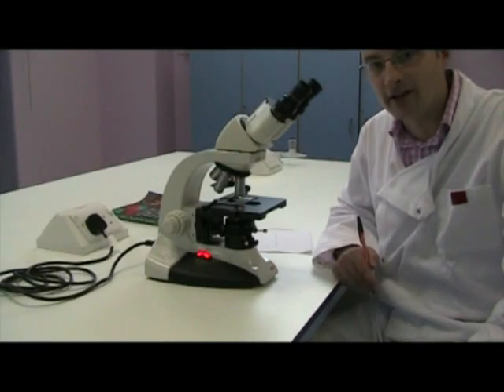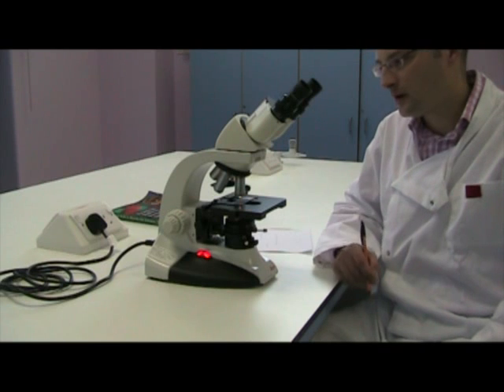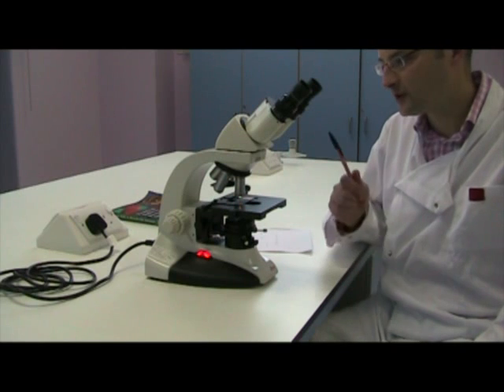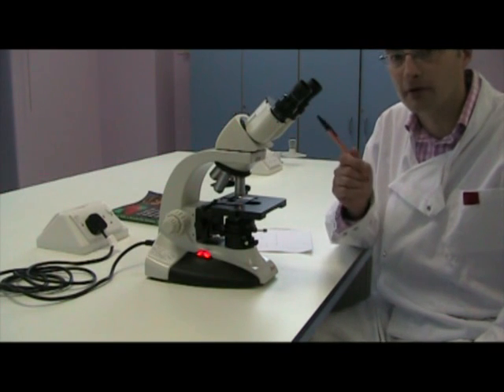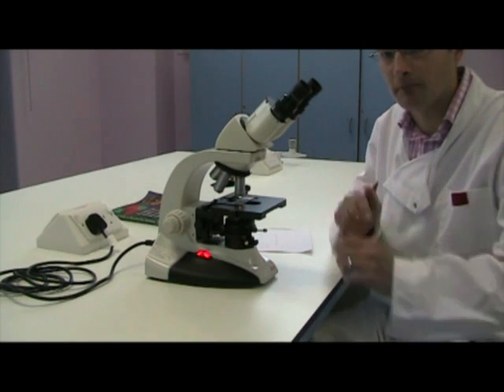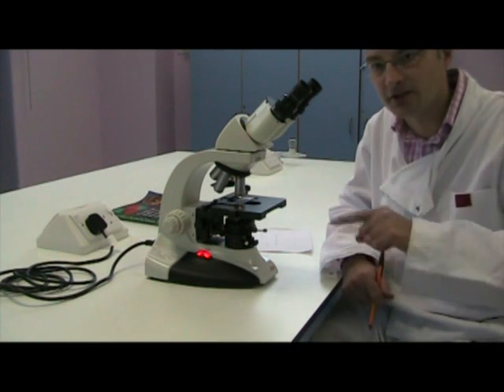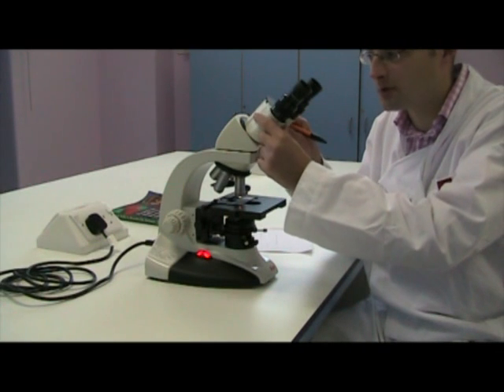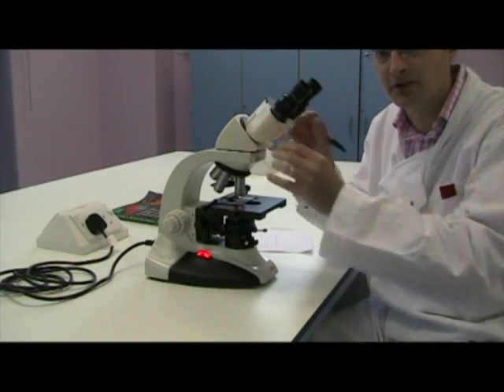The microscope is now ready to view specimens. There are a couple of things you need to be aware of while using the microscope. First of all, always look down both of the binocular pieces — don't close your eye and just look down one at a time. You should, when you look down both binocular pieces, see a nice circular field. If you can't see a circular field, then the distance between the eyepieces is incorrect and you need to alter it.